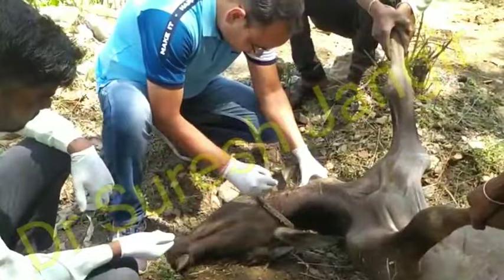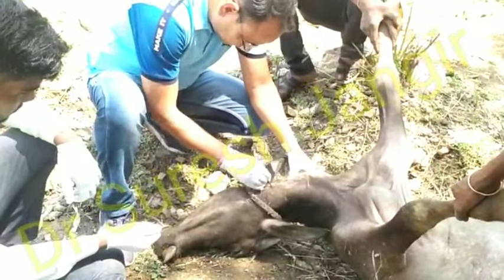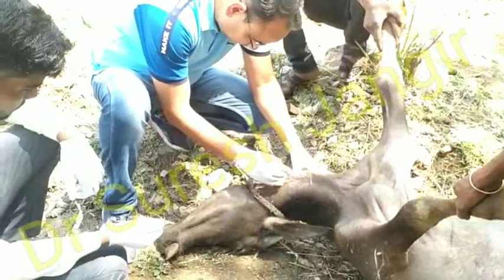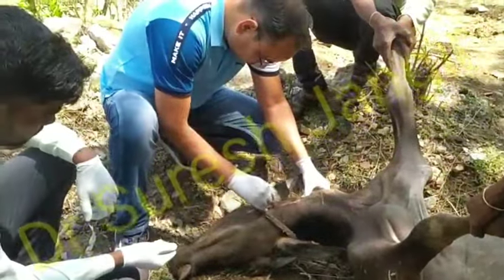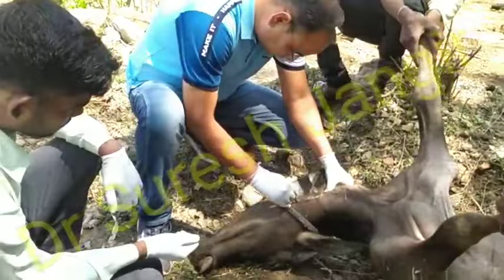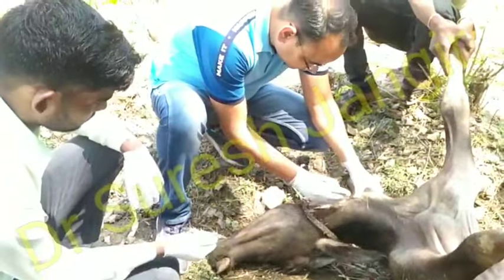First of all, we have to go for external examination. In external examination, we should examine its mouth, its tongue, its eyes, pupil, ears, and body surface.